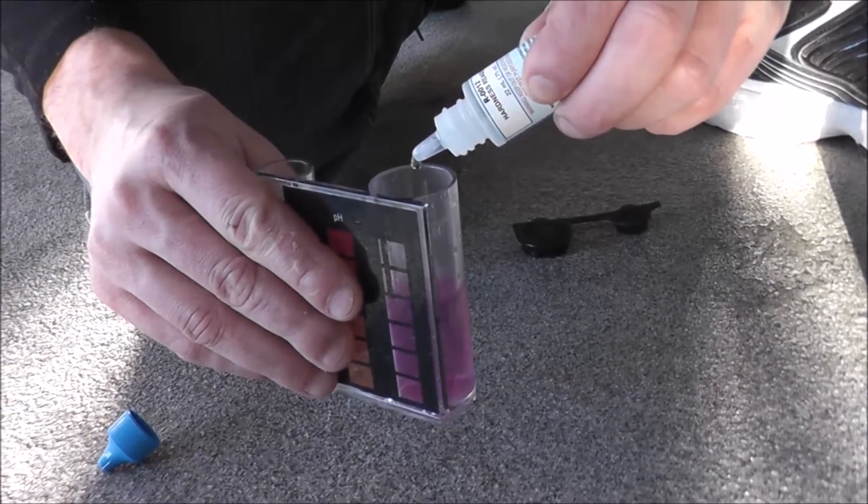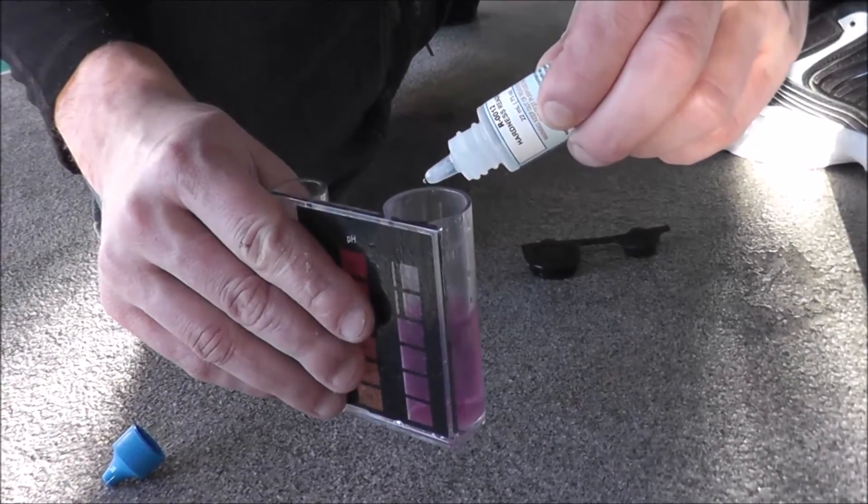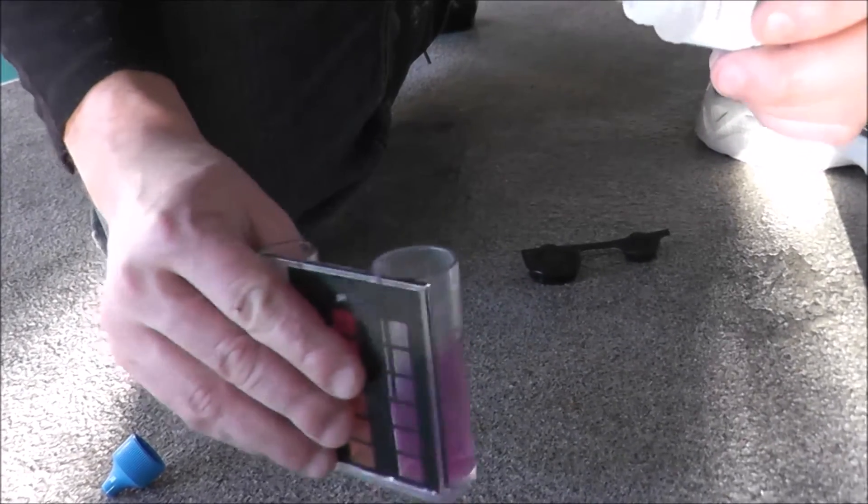Counting 1 through 10 drops — that's 10 drops, equivalent to 100 parts per million.